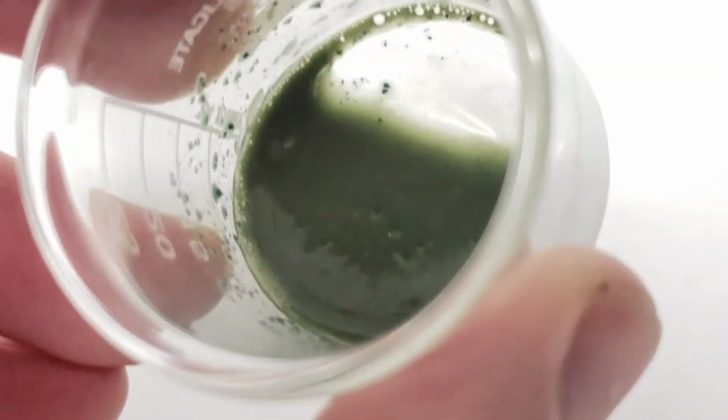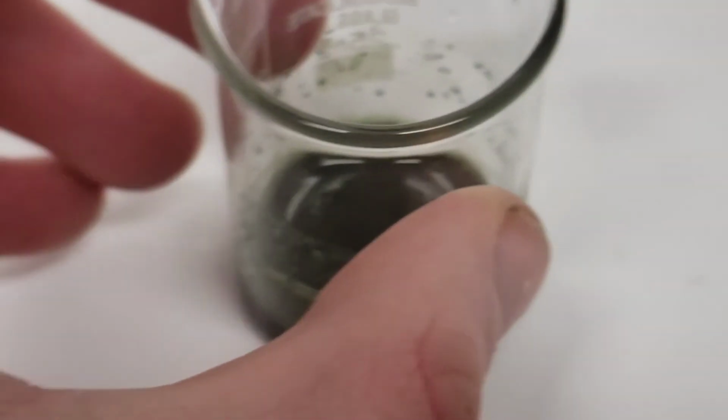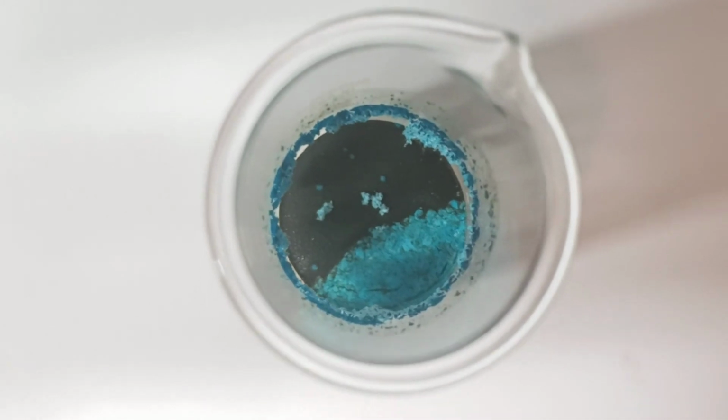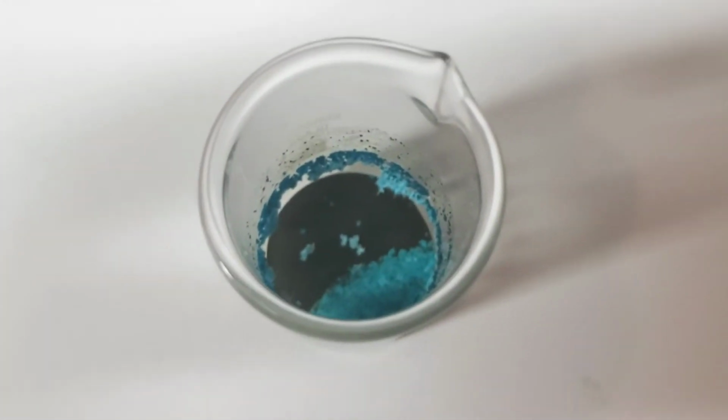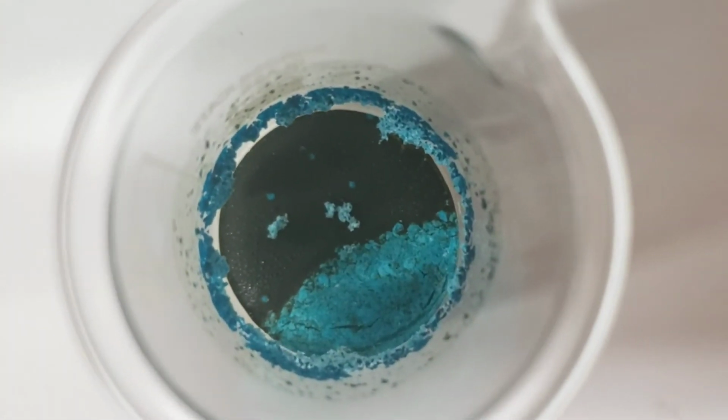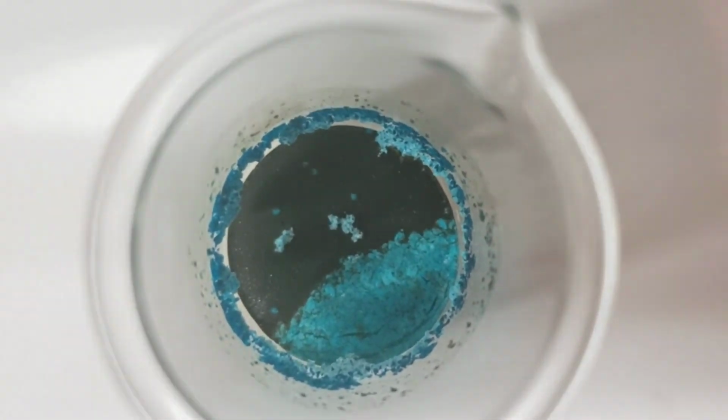So I then let it out overnight to dry, and the results were the following. So yeah, it does look like there was some separation between the copper acetate and the carbon, but they're still in the same solution, which is of course what I was trying to avoid. And so I'd still have to resort to manually separating them. So for this bit at least, this is where I stopped. In the future, I'll probably separate them using alcohol or something like that, but now I'm just pretty tired.